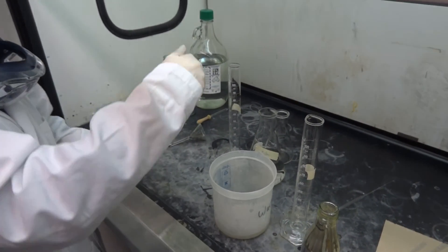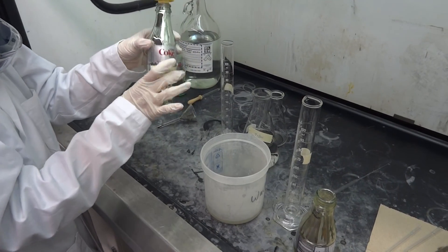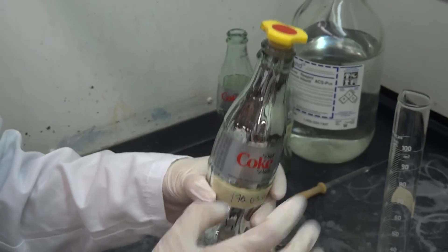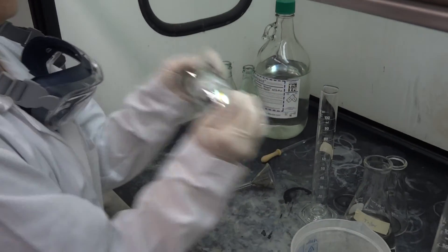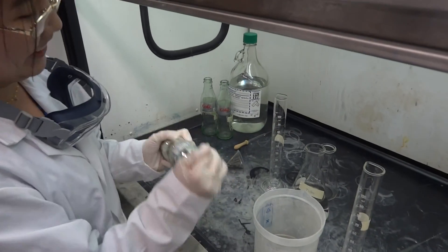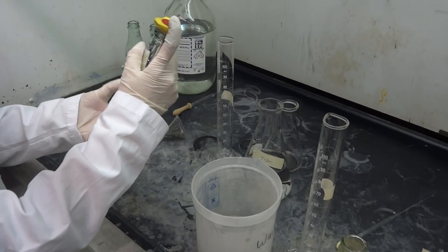She can stop now. Oh! Oh, that is beautiful. That is what you call a silvered Coke bottle — way better than what I did. Let's just coat it better. For those of you who are watching, Eugenia is a very thorough person.